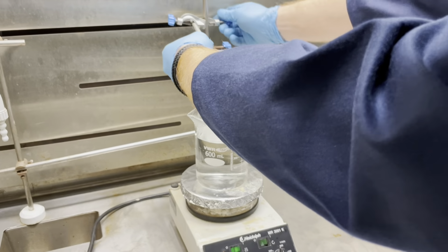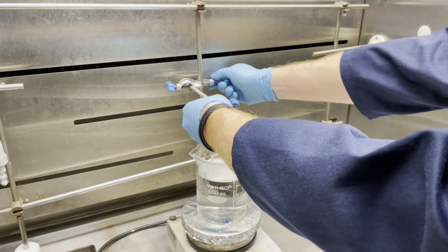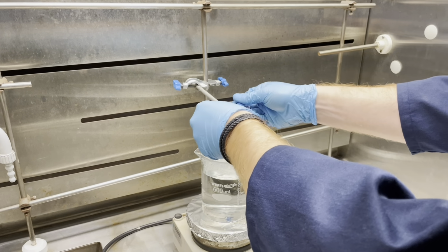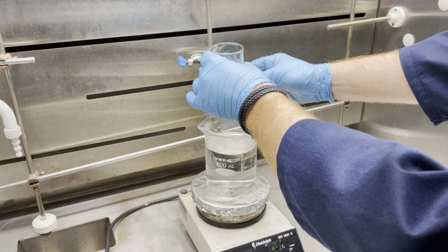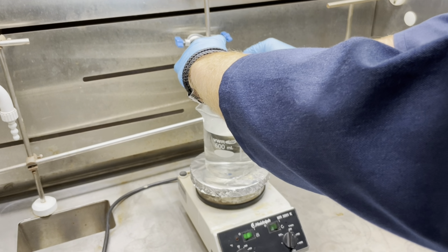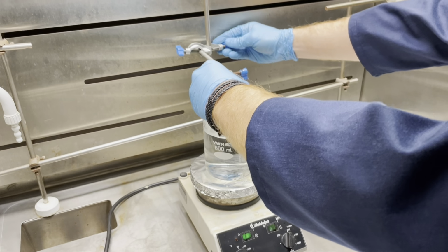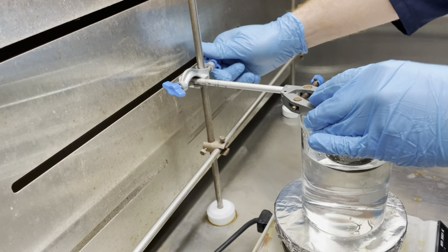Next, you will clamp your reaction vessel in your water bath. To do this, take a clamp and secure it at the back of your fume hood, slightly above the water bath. Next, place your 100 ml beaker containing your reagents in your clamp and lower it into the warm water such that the level of the water is above the level of the reagents in your beaker.